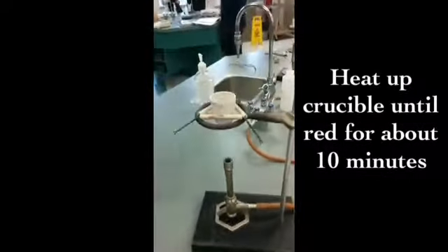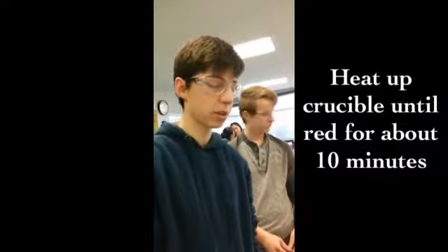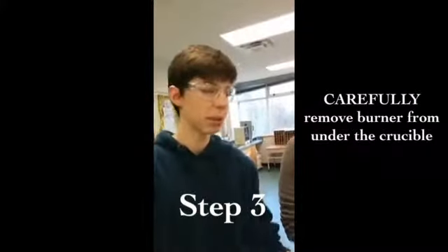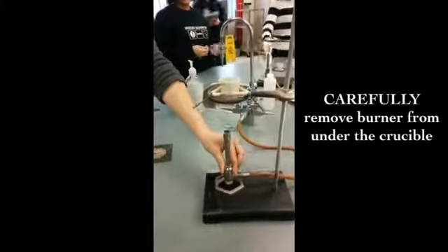After a few minutes, the crucible is going to glow a dull red. That means it's really hot. After it glows red, let's wait about 10 minutes before turning the Bunsen burner off. Now that it's been red for about 10 minutes, let's turn the Bunsen burner off.